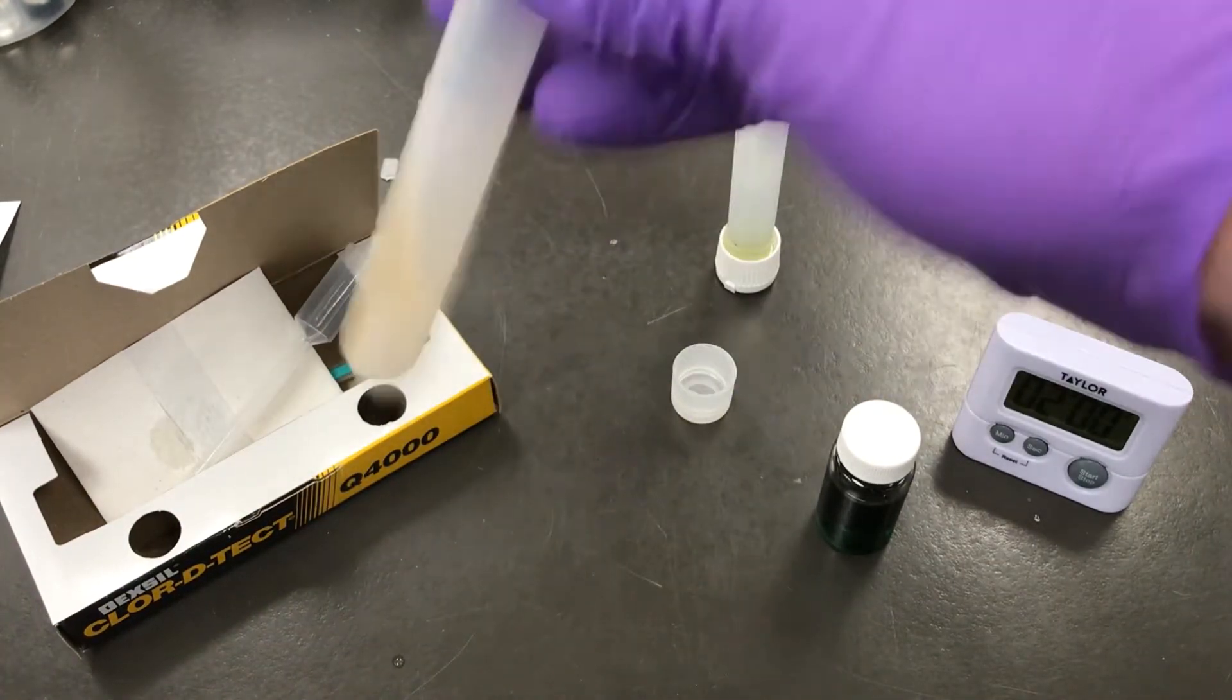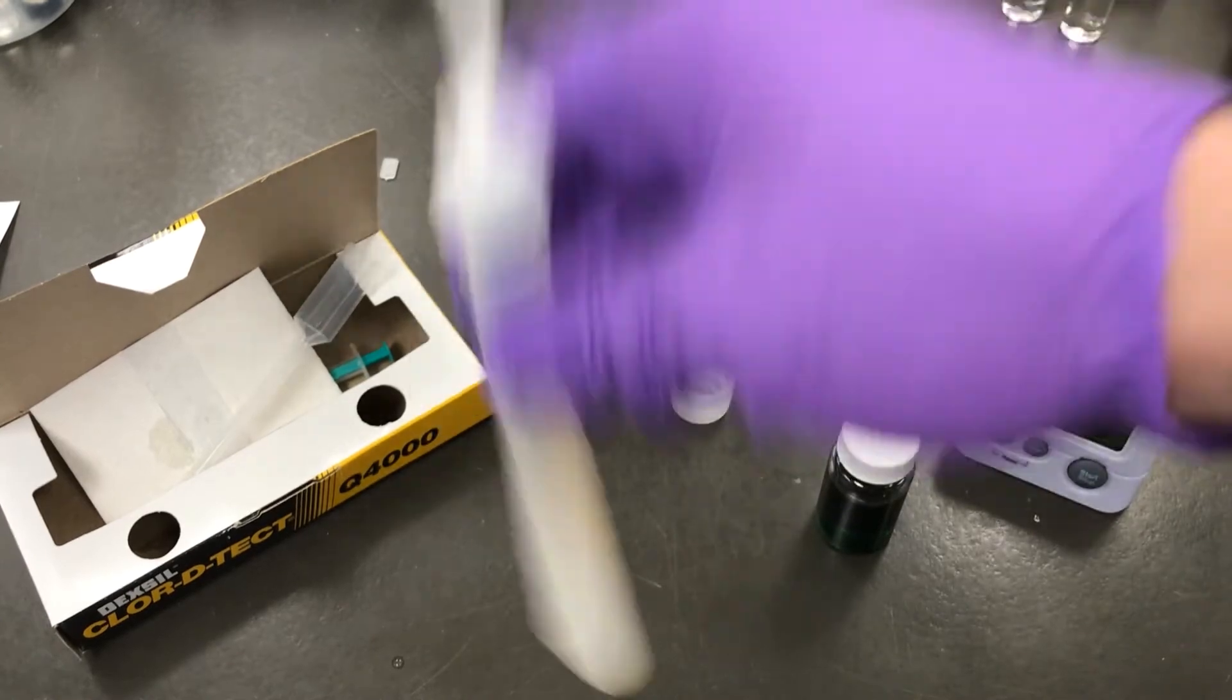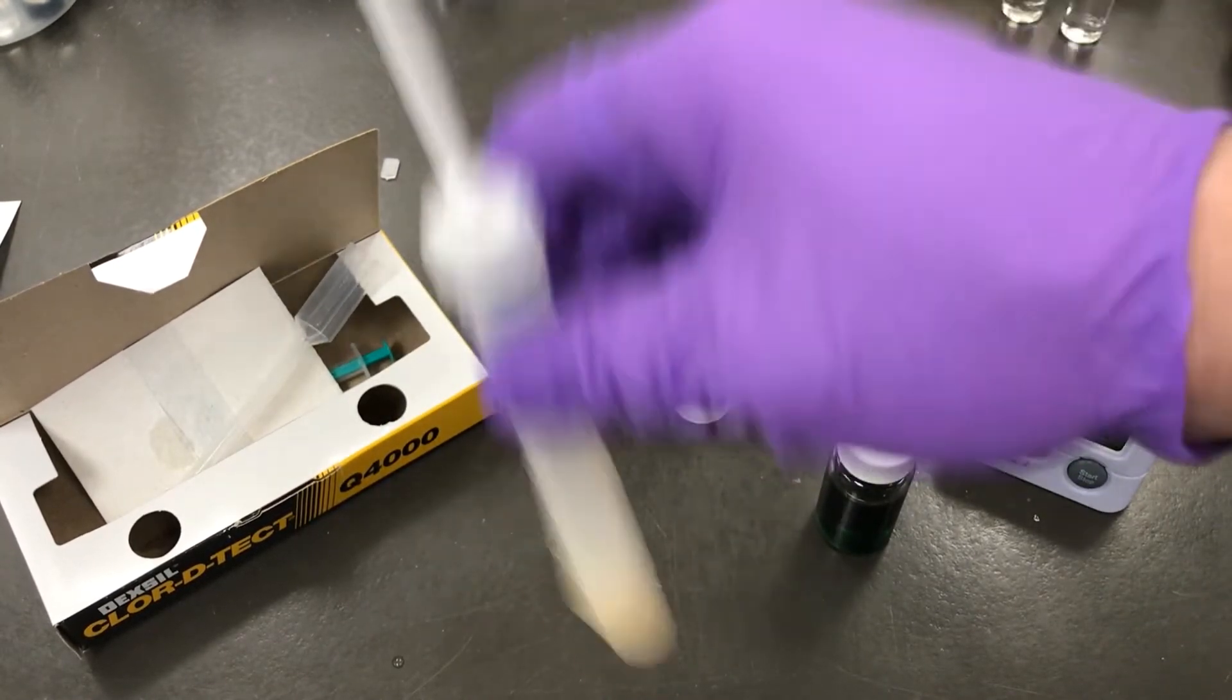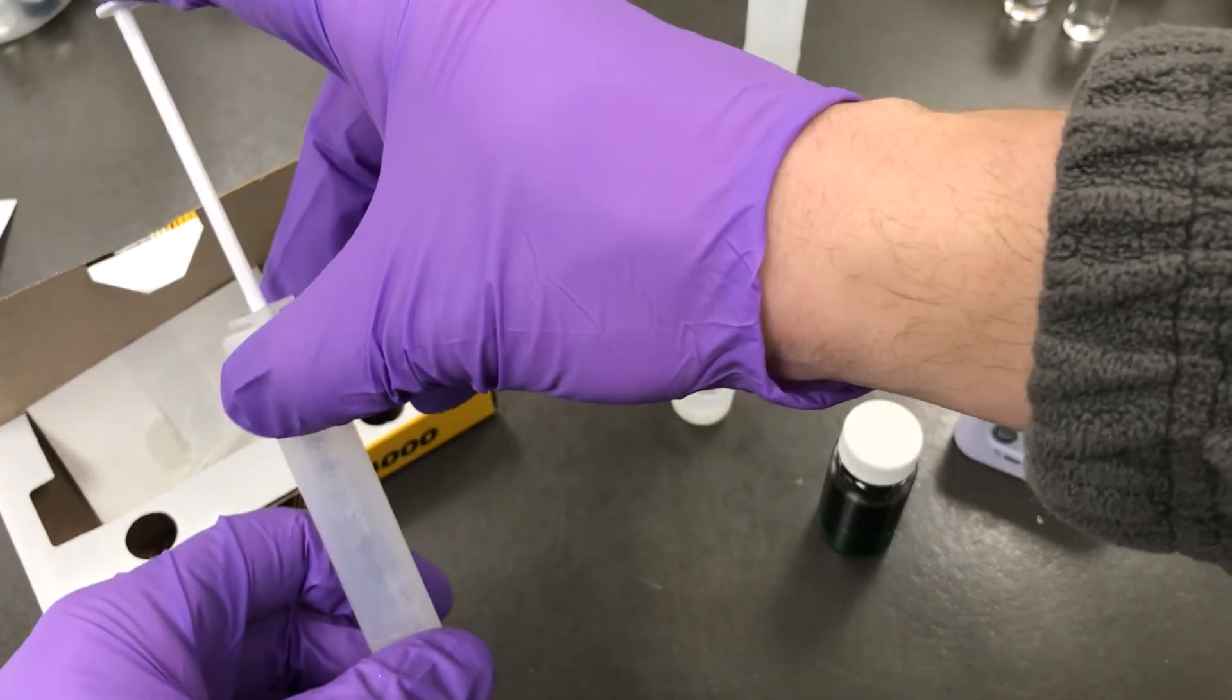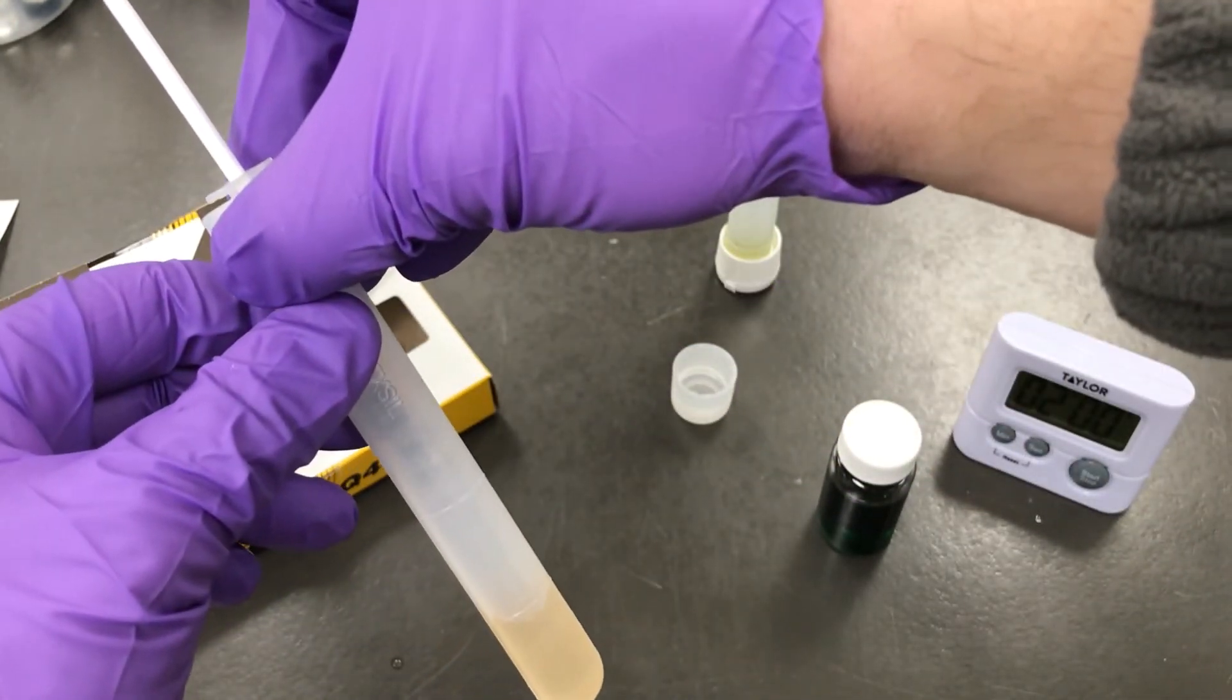Once secured, you can crack that bottom colored ampule in test tube 2 and shake it for 10 seconds.